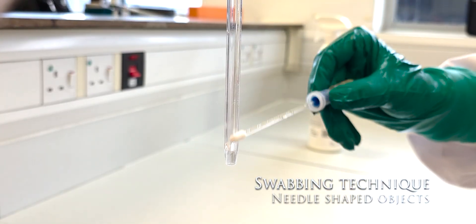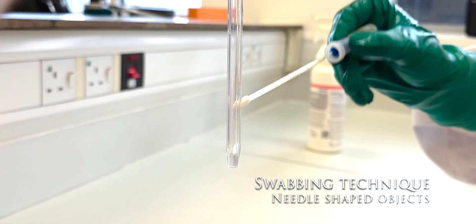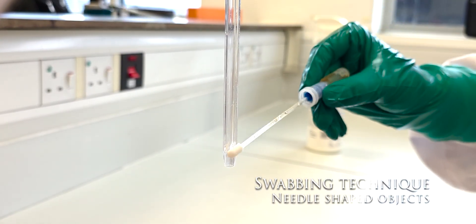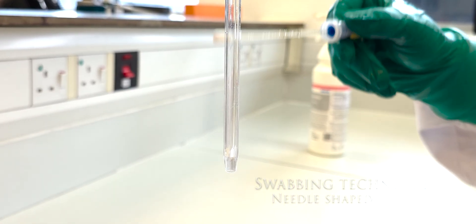When swabbing needles, pass the swab over as much of the surface as possible whilst rotating it continuously. Ensure a minimum of 5 passes.